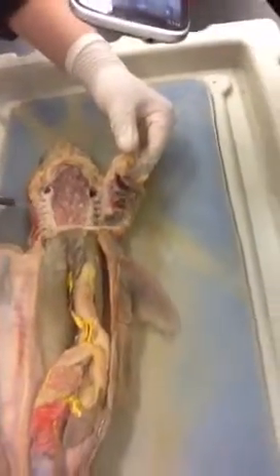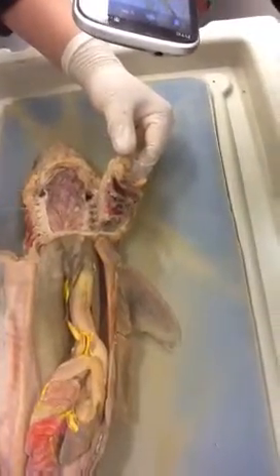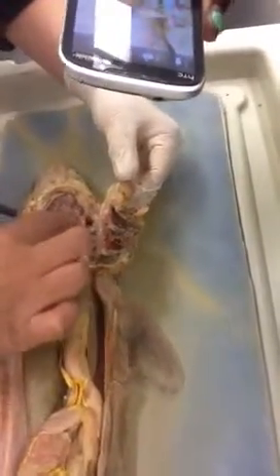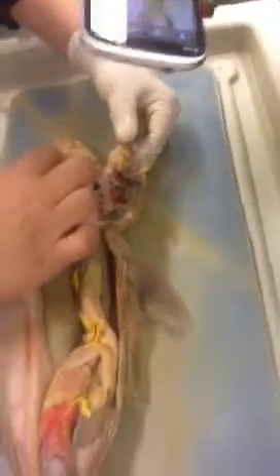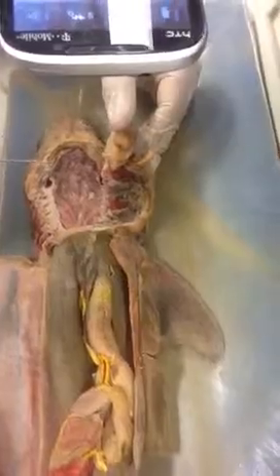Those are your efferent branchial arteries that meet up into your dorsal aorta. And if you're going to the cranial end, you can drain into your radix aorta, which are those two. And then your, excuse me, internal carotids, which is the top thing right there. And I want to say that the one before the radix joins up is the hyoidean epibranchial. And I think that's all you can see.